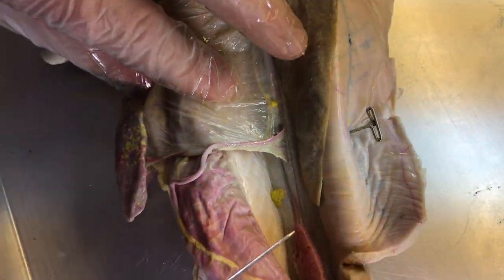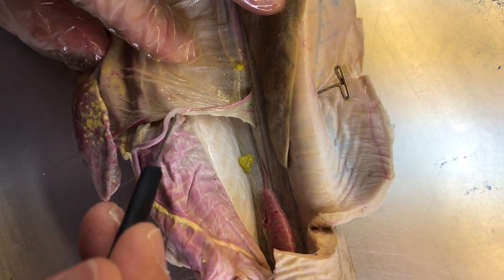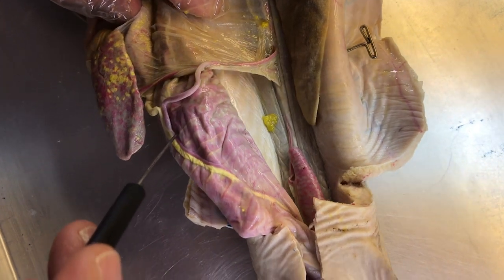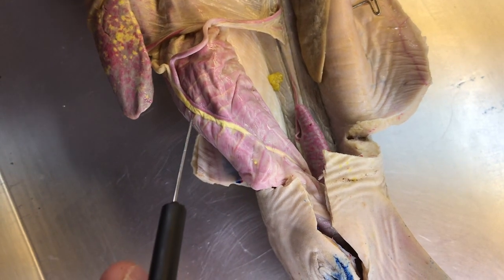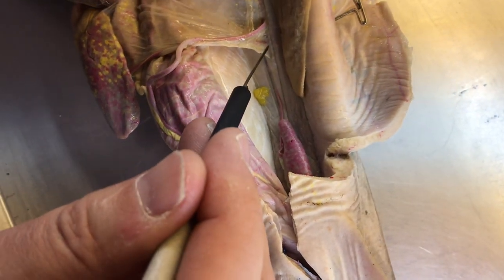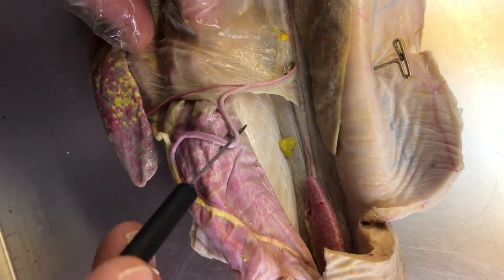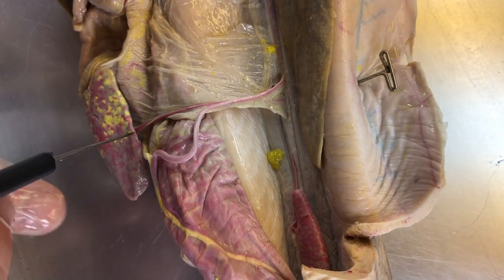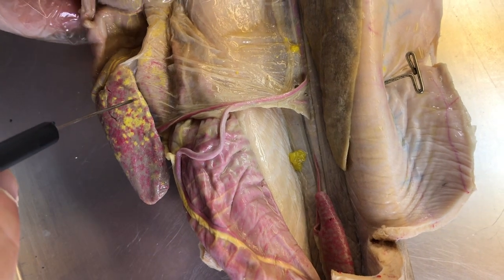Now, the next two branches off the dorsal aorta, next one will be this nice large artery here, and this is the posterior intestinal artery. It'll come up and go to the posterior part of the intestine, and this also will connect up to those annular arteries that we saw. The third branch, you barely see it here, this is the gastrosplenic artery. If I flip this over, you can see it much better here. The gastrosplenic artery will come up to the spleen and then to the pyloric part of the stomach.